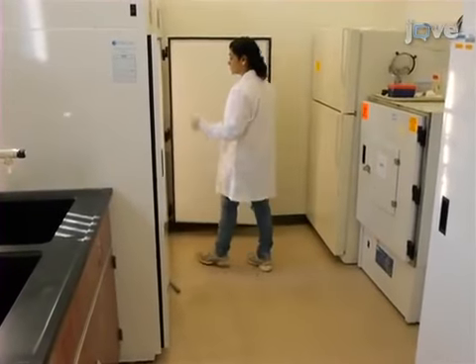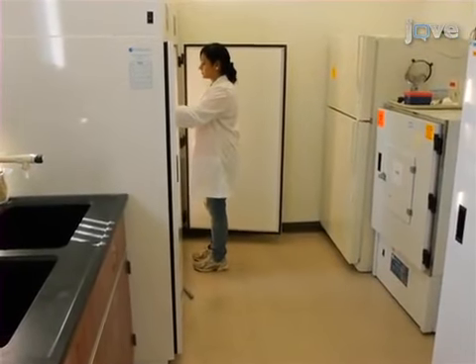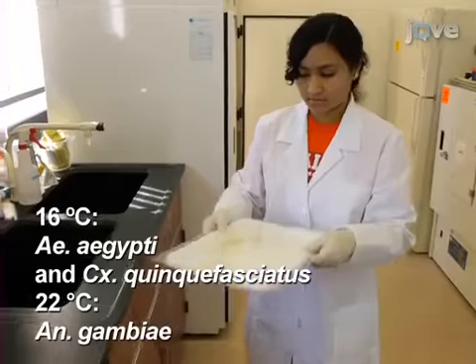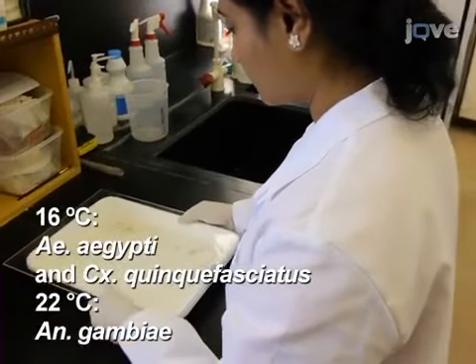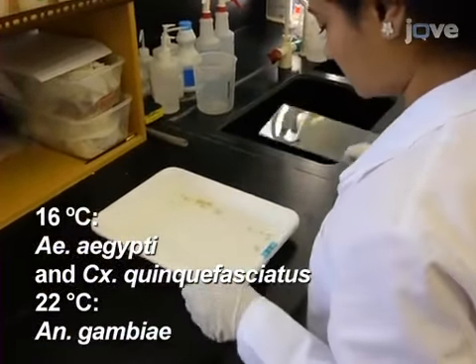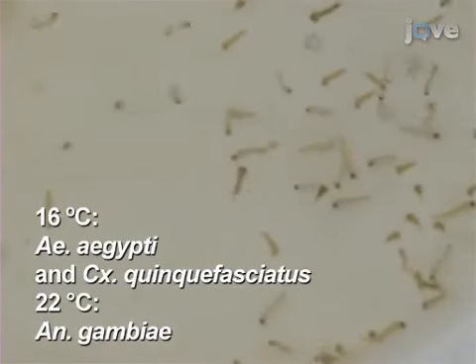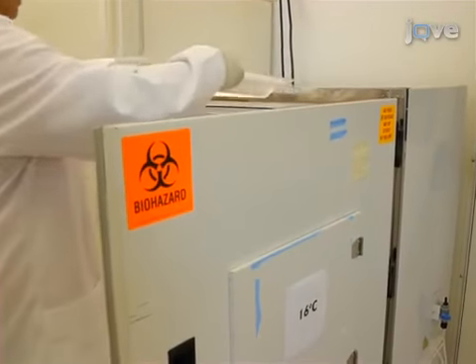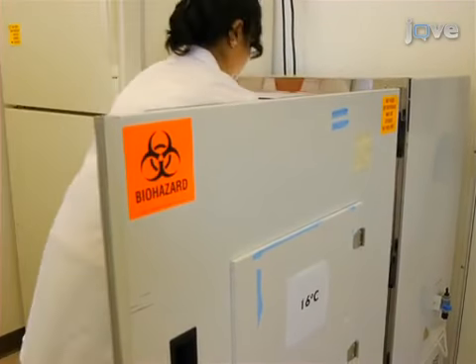Using standard protocols, hatch mosquito eggs at 28 degrees Celsius. After 2 to 3 days, transfer second or third instar larvae to 16 degrees Celsius or 22 degrees Celsius incubators, depending on the species. The instar stage of development is based on head capsule size.